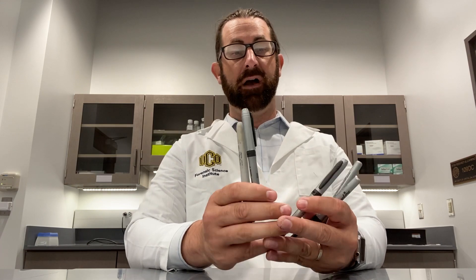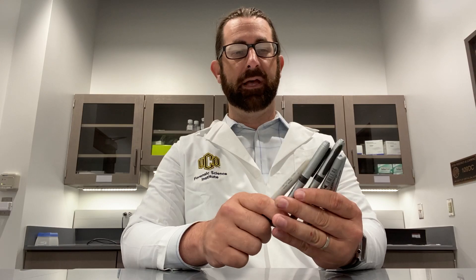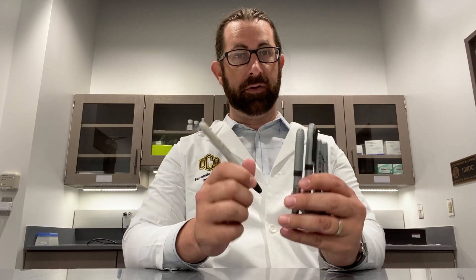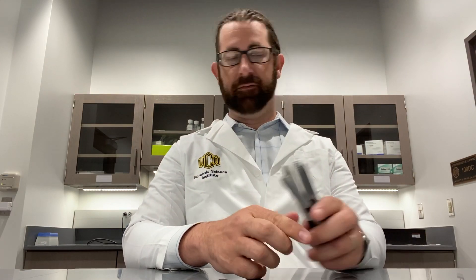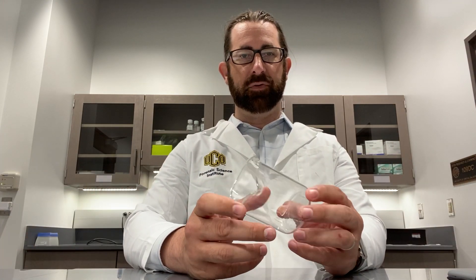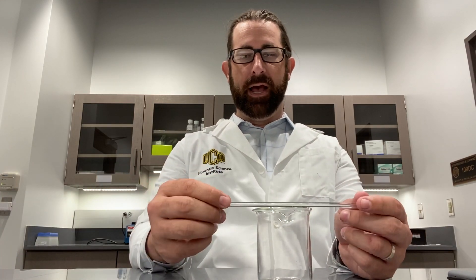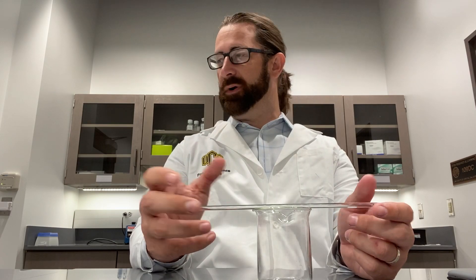A series of black pens — it would be best if they are different types of pens. So I have a few here that are the same, but different types of pens are going to be most effective for you. We need a container. This container needs to be fairly small; we don't want it to be huge — you'll see why in a second. And then some form of a support structure.